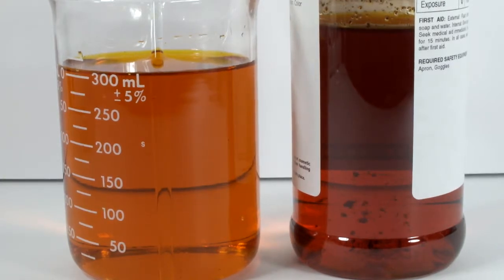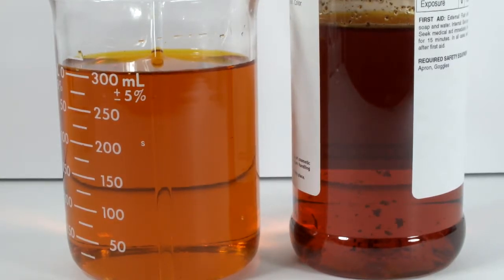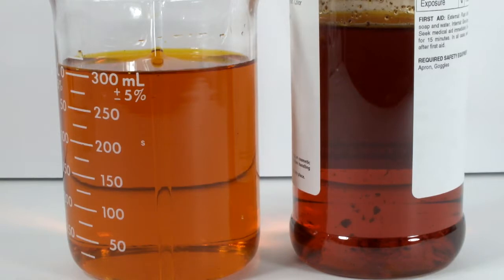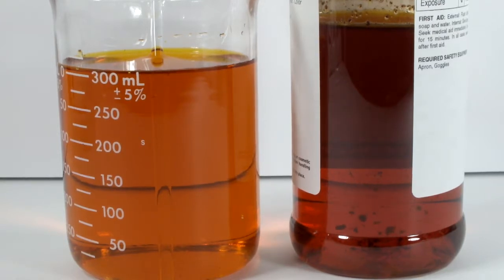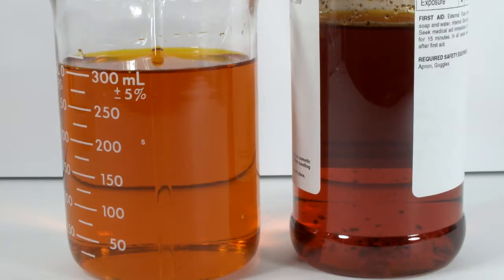Side by side, the fresh solution is a bit lighter. Maybe my stock solution is just too concentrated. But I thoroughly disagree with one description of the shelf life that suggests the color fades over time. My bigger issue is the junk. The color is fine.